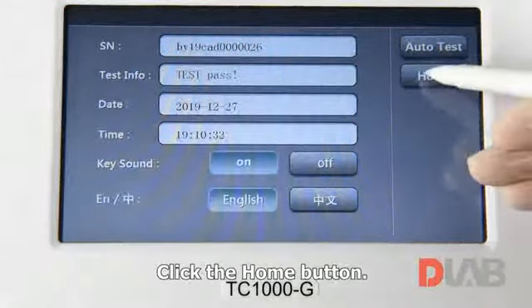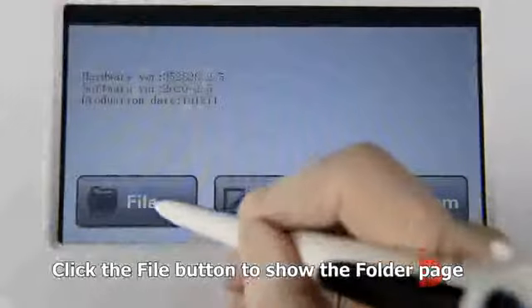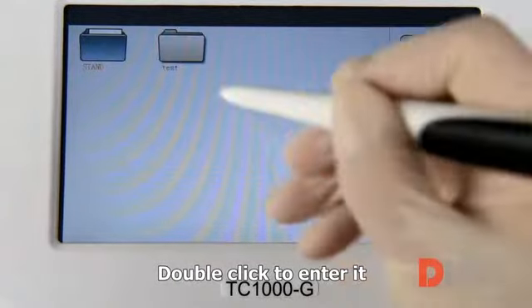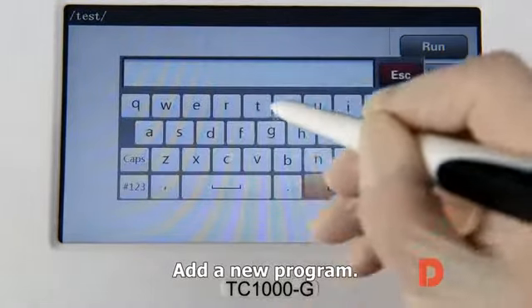Click the Home button. PCR Protocol Setup. Click the File button to show the folder page for up to 16 folders. Add a new folder. Double-click to enter it for up to 16 programs. Add a new program.